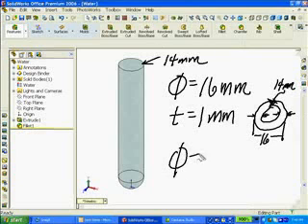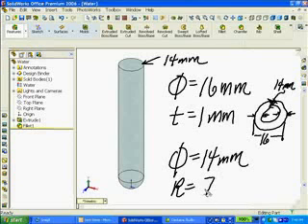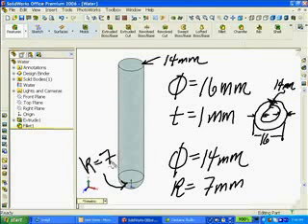If my diameter of the water is 14 millimeters, then the radius has got to be half the diameter, which is 7 millimeters. And that is the value that I used for my fillet radius. I have my water measured, and I have my test tube. I can use this water and the test tube to create an assembly.